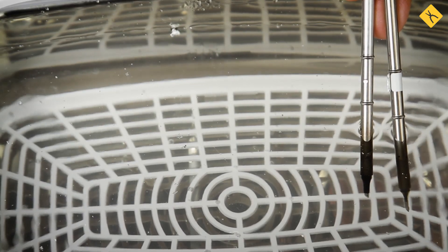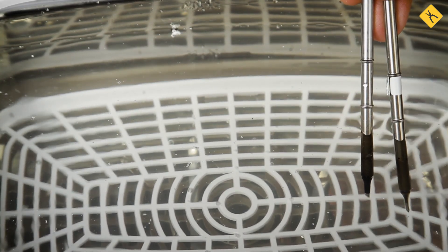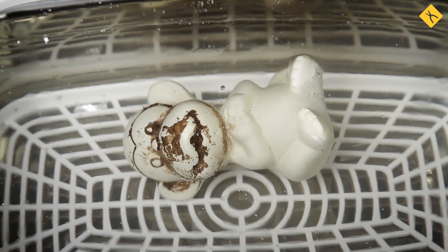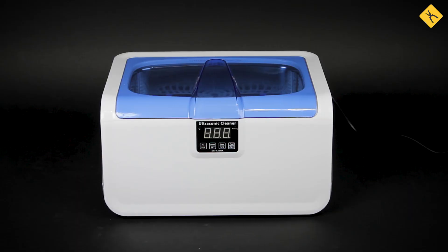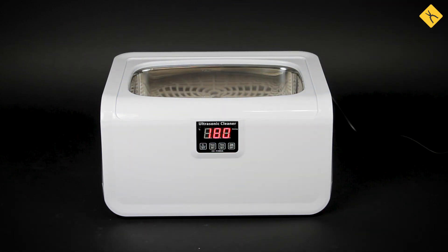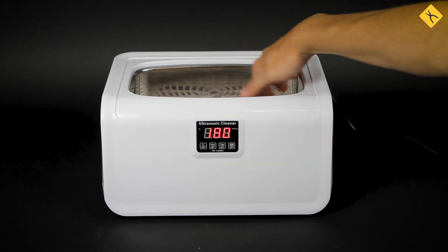It is especially useful when you need to clean objects with uneven surface or complex structure. You can't really see how the ultrasonic cleaner works. When the machine is on, it generates a special wavering sound. But how do you know what is actually cavitating? How do you check that it works properly?